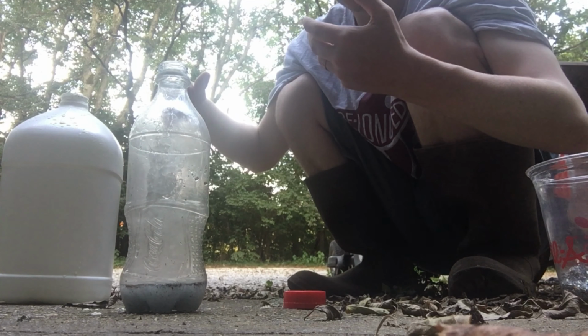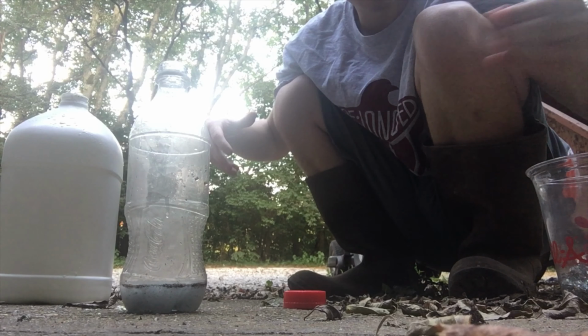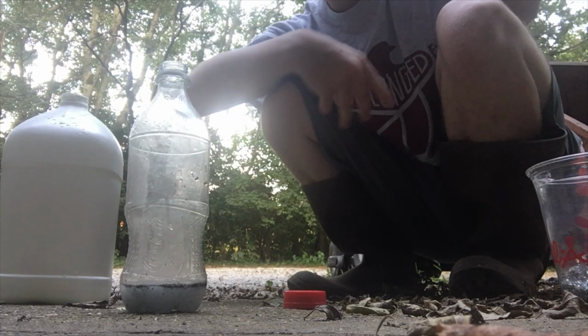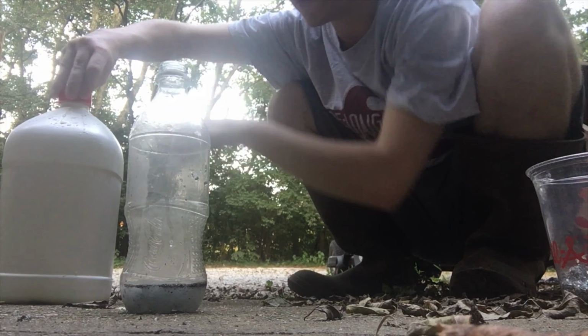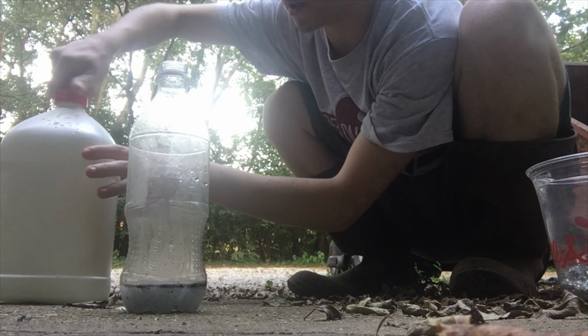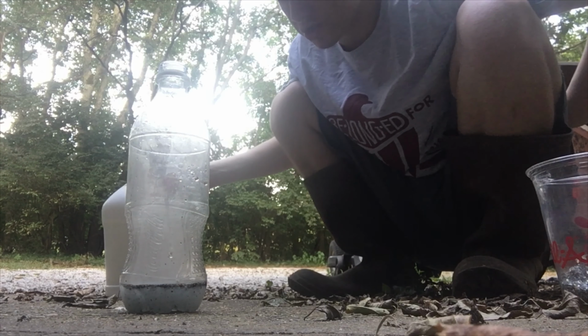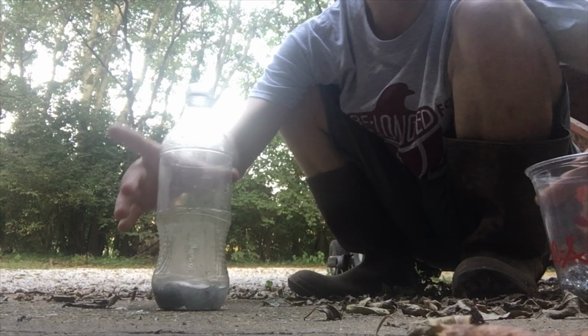Okay, that was not what I wanted. Got a little on my hand. Okay, let me see if I got a little bit of a base here. So yeah, I have a little tiny thing of neutralizer for my hands, just in case I get it on them, because I didn't want to touch my phone with these gloves that I have over here. But usually you will always want to use gloves when handling any sort of acid.